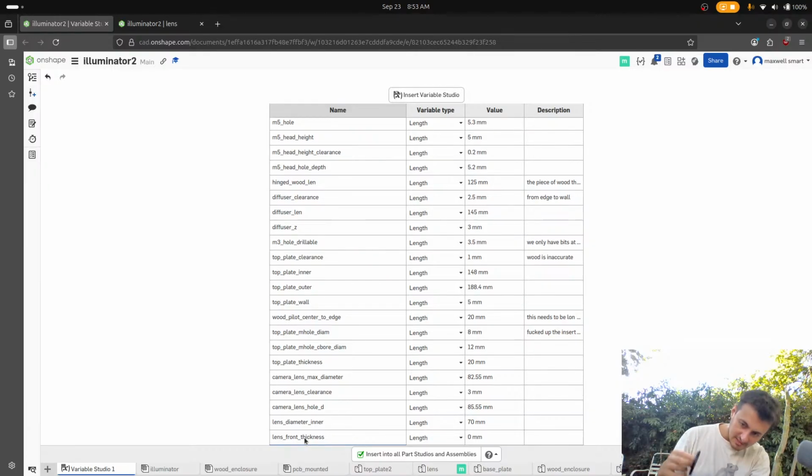Okay, so what we're gonna say is that I just measure it one more time with these guys. Okay, 17.45. 17.5. Let's do 17.5. There's kind of a lip on it, but I'm not going to model the lip.